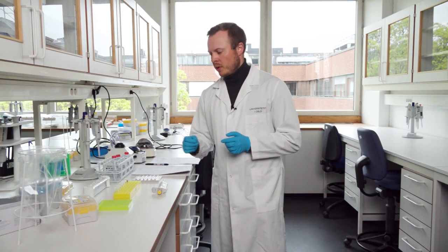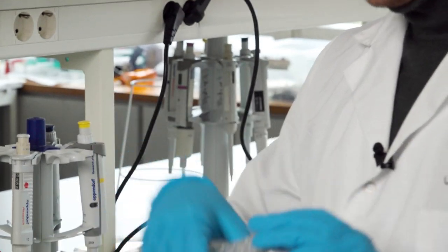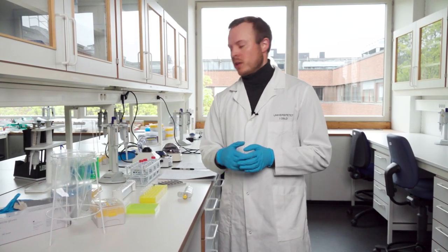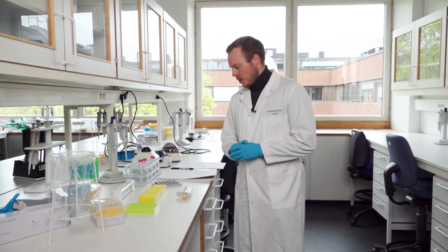We have two different procedures for PCR bead cleaning: one for normal Eppendorf tubes and one that uses a PCR plate. For the plates we use a magnetic rack, and for the tubes we use a different magnetic rack. I recommend using the correct procedure for your samples — if you have around 20 up to 32 samples you can use the tube racks, but more than that you should use the plate because it's faster and can do multiple batching. Be aware there are two different protocols.